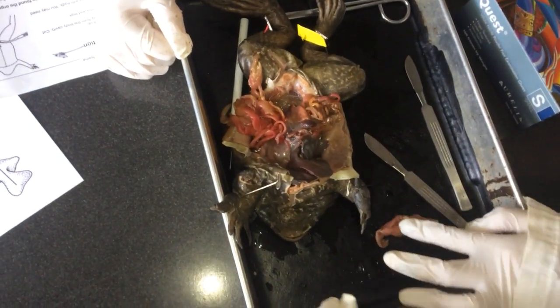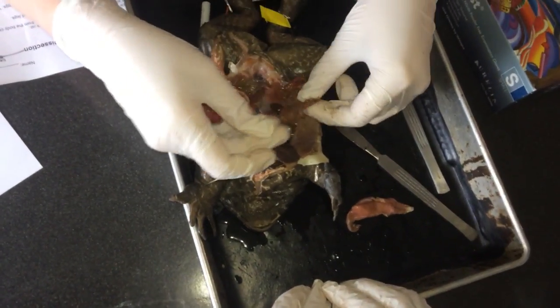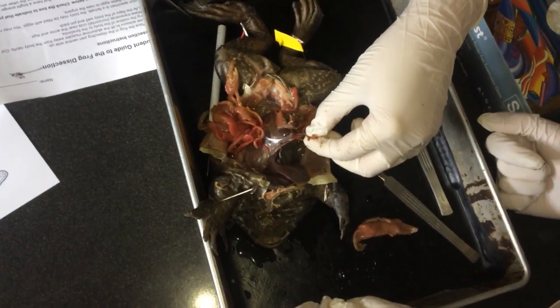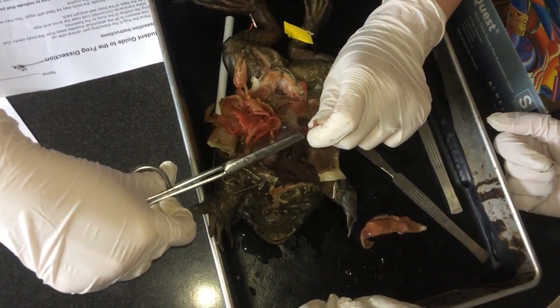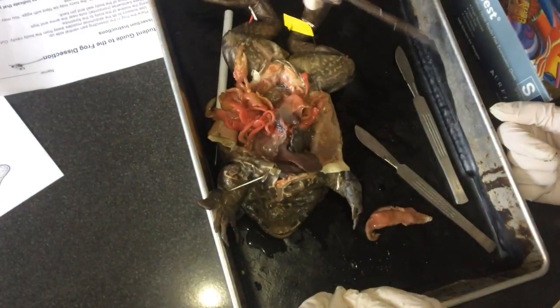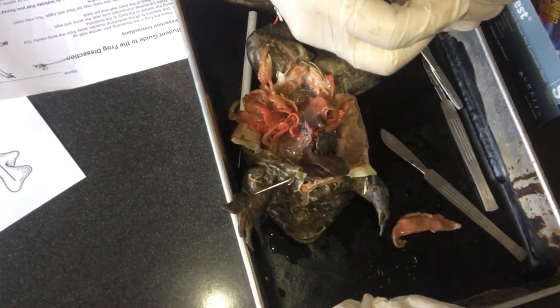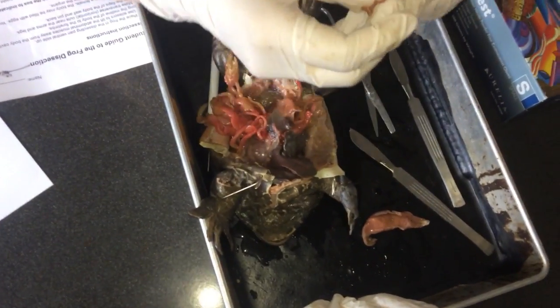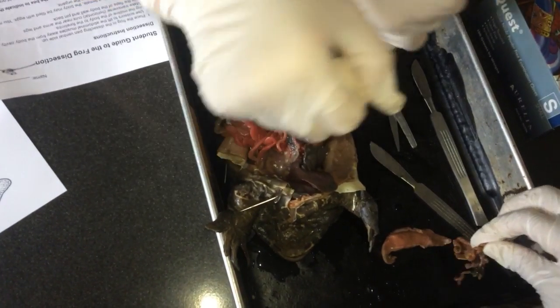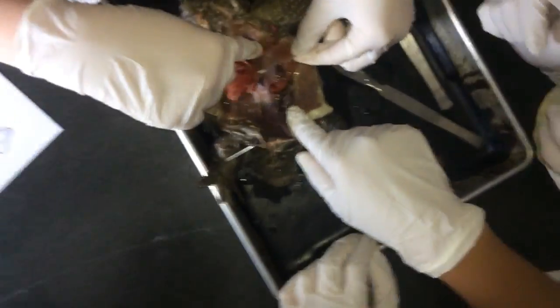Stemming. We want to take out the small intestine, which is this guy. Let's see how long it is. There it is. This smells so bad. I don't want to see how long it is. Well, there's that. Small? This is small. Mm-hmm. This is large. It's super muscly. The large intestine right here.